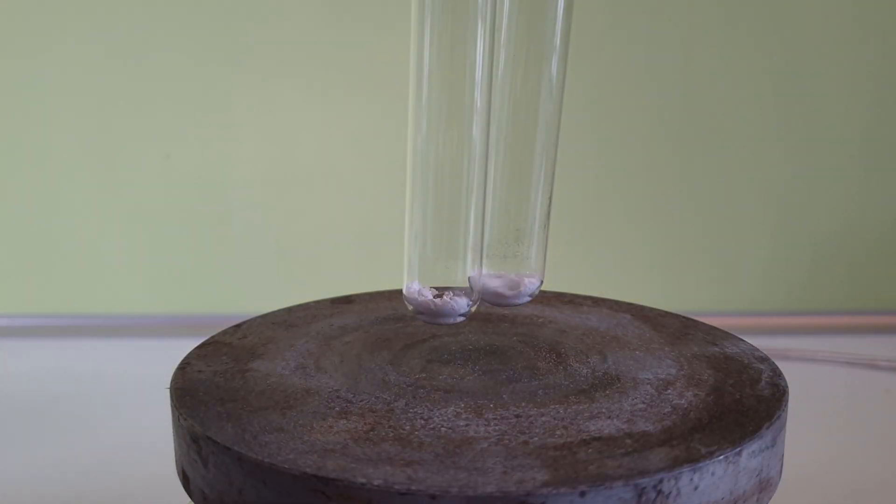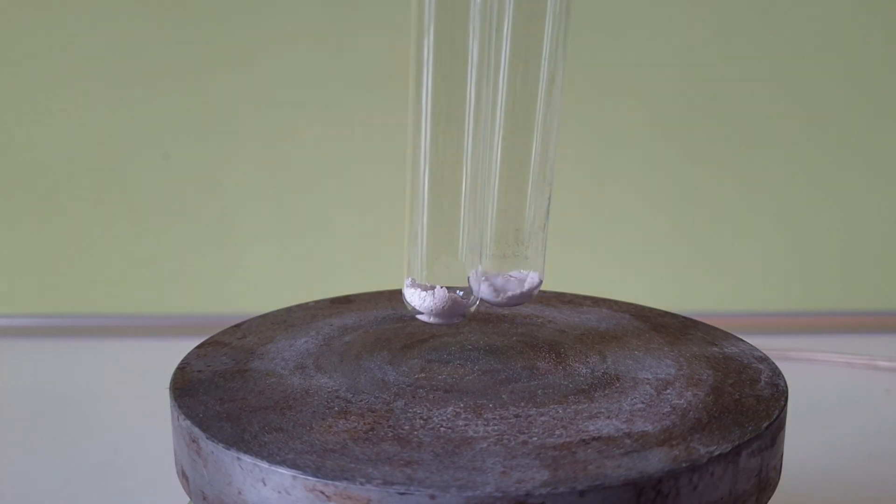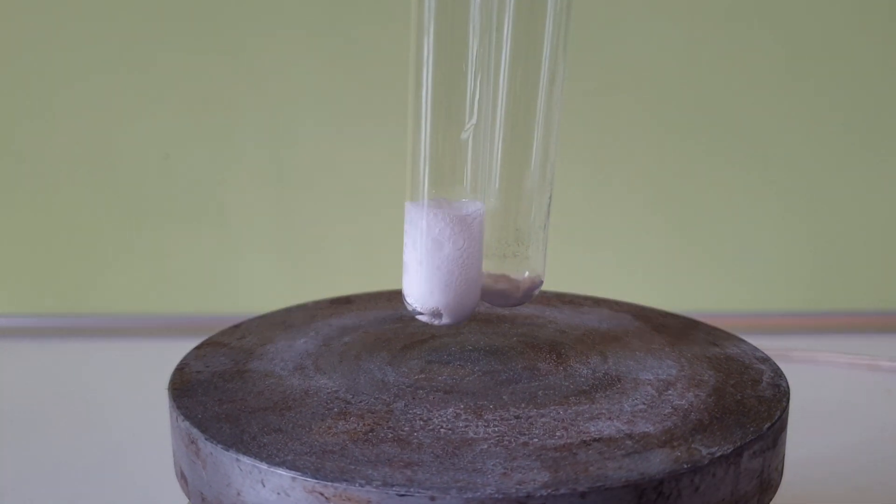I'm going to use 220 milligrams of strontium carbonate, which I'm adding to these test tubes.